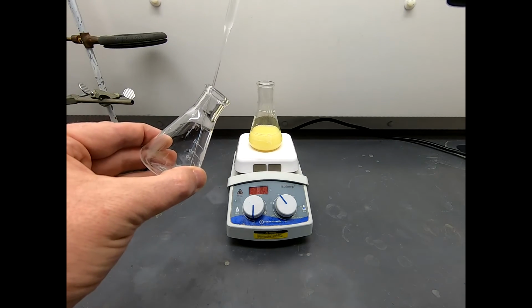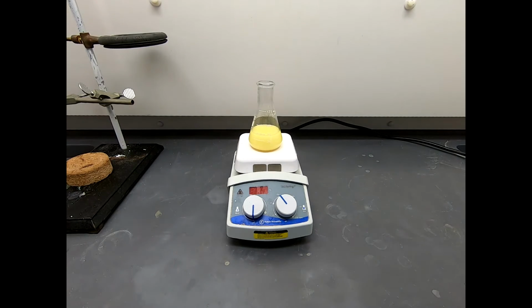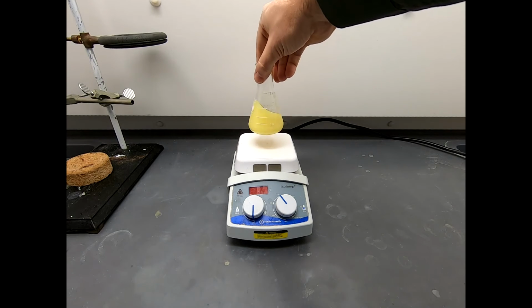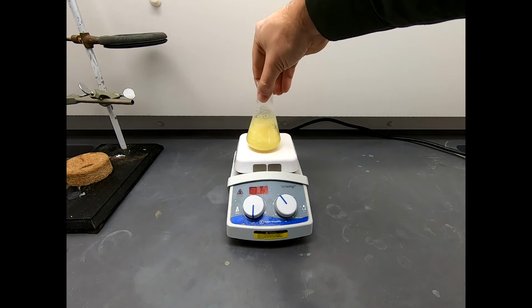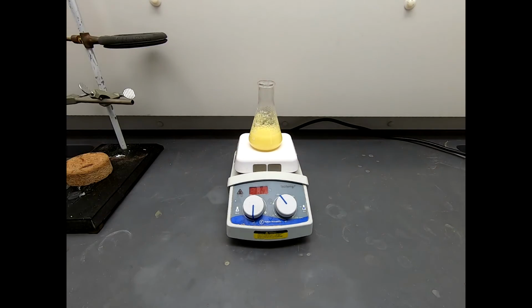And that little bit of ethanol is not going to mess up the proportions of our ethanol water overly, so we're fine there. So this is going. Let's pull this to the side. Now hand swirl it, and you can see when I hand swirl it, there's plenty of solid. The solid is kind of slopping up on the sides.